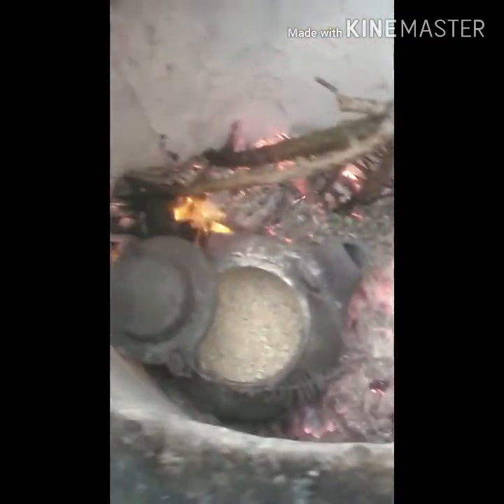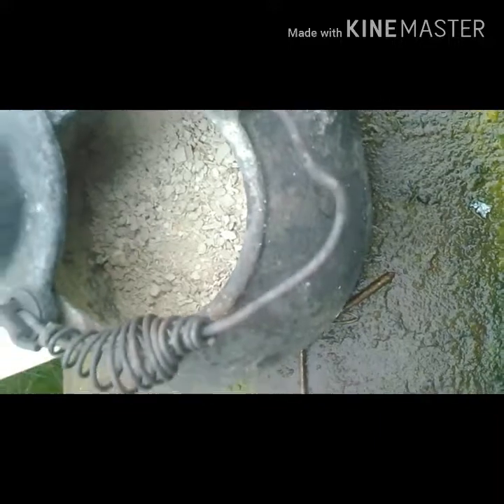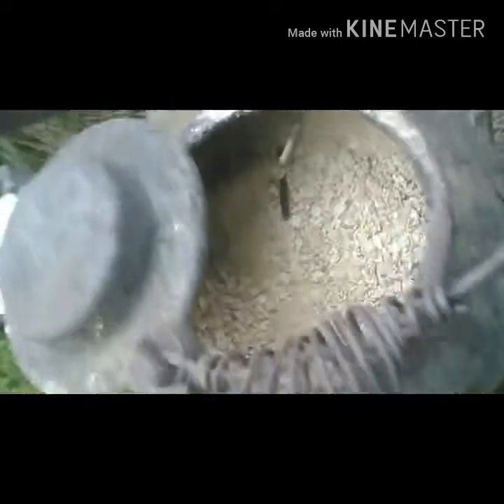It's been about two hours now and you can see it's turned yellow from red. There's still a little bit of red remnants in there but I'm calling that good. It's out of my kiln now — give it a good stir and see what it looks like. It's more like an almost peach color I'd say, but either way this is litharge now.